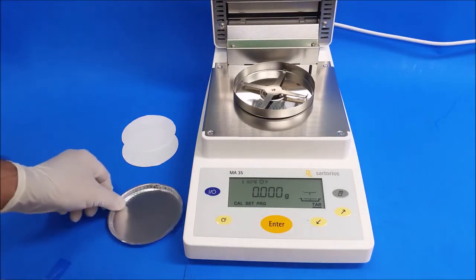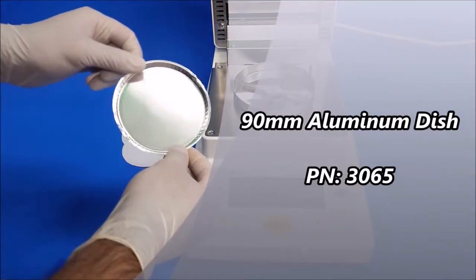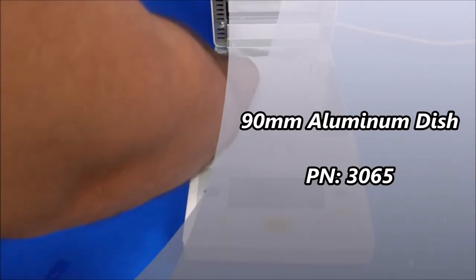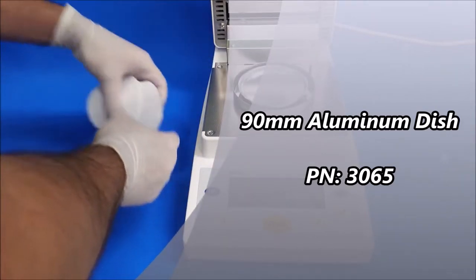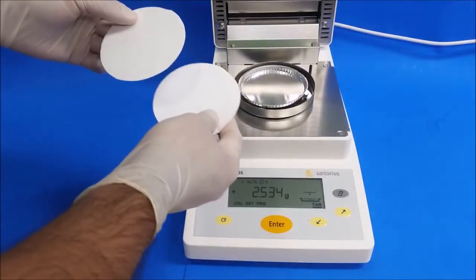Now I'm going to put an aluminum dish and two fiberglass pads.